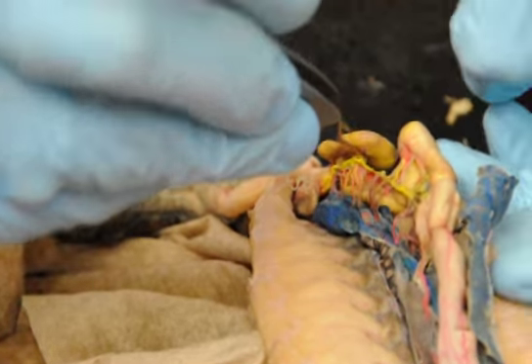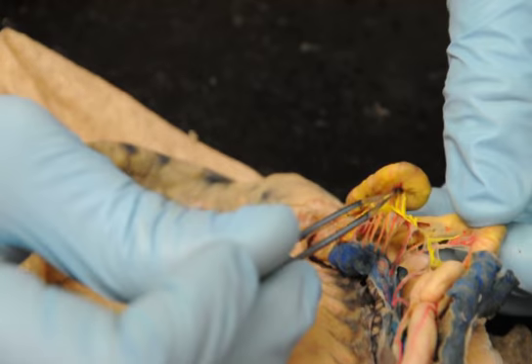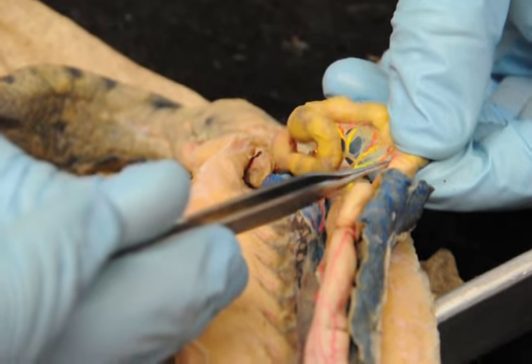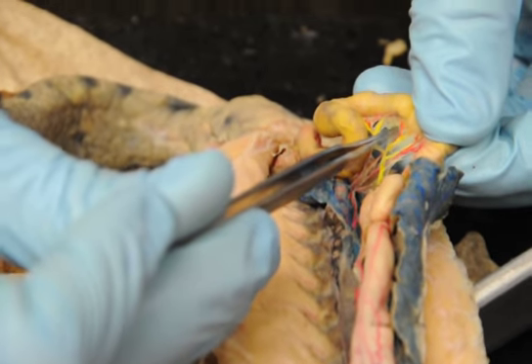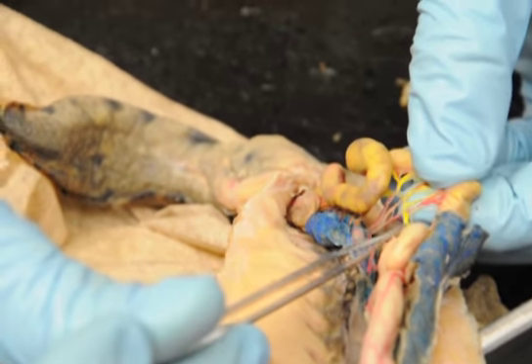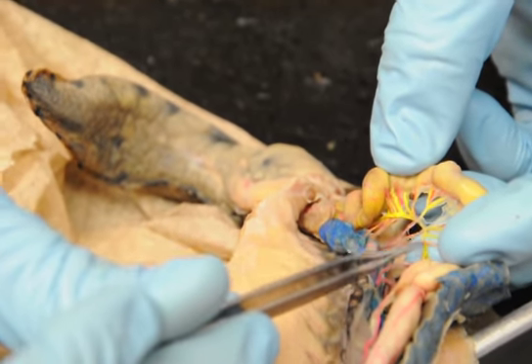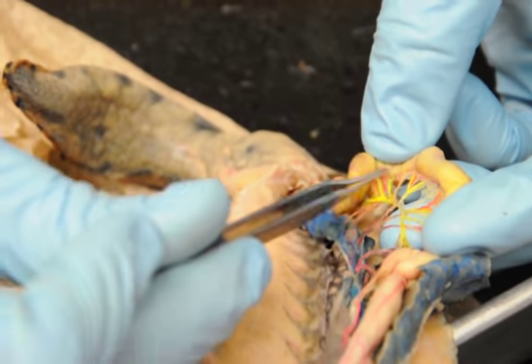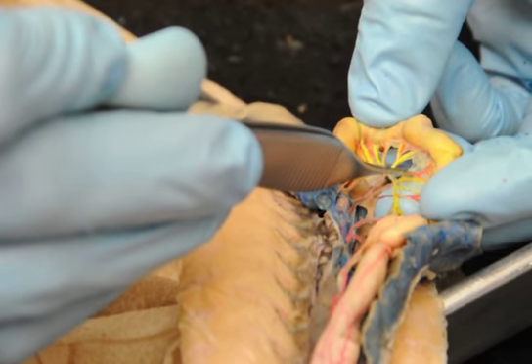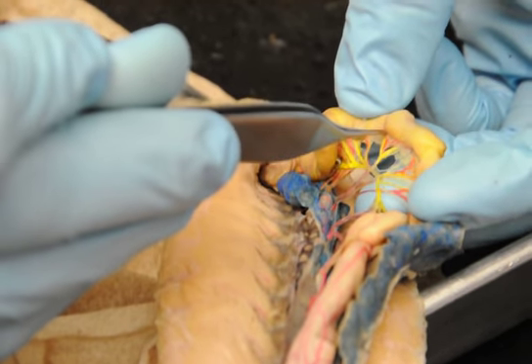Then for the arteries, the rest of these going up to the intestine and all the mesenterics, there's lots of them. Then the intestinals are the little teeny tiny V's right next to the intestine. That's the part that's the intestinals. For the arteries, they differ. For the vein, you only have one mesenteric, and it runs right through the middle here, this big guy. That's the single mesenteric, and then all of these larger ones going up to the intestines are the intestinal veins. So right next to them is the mesenteric artery, intestinal vein. Intestinal arteries don't happen until they get further up.